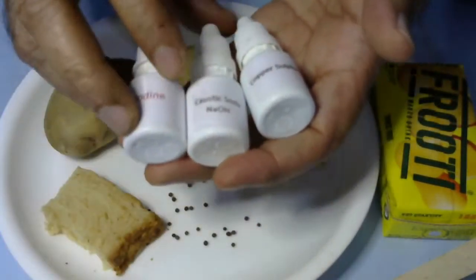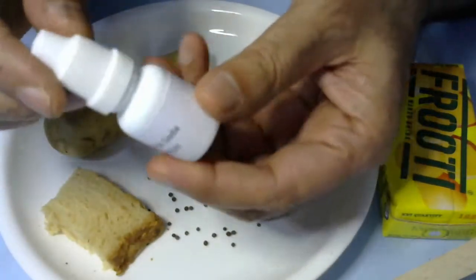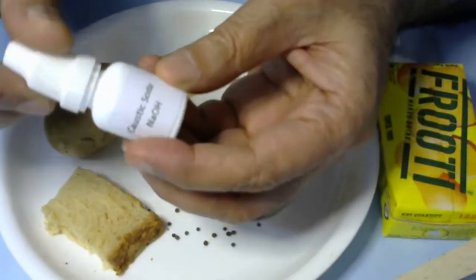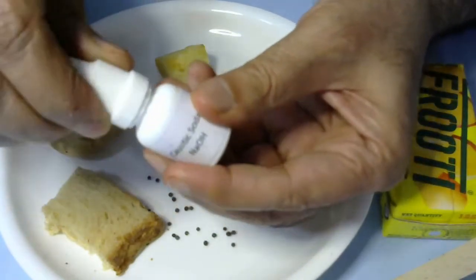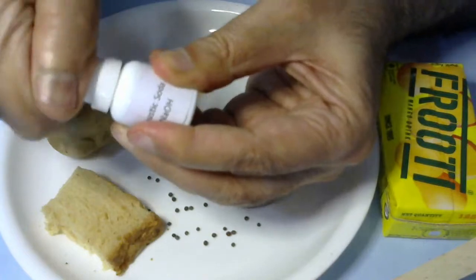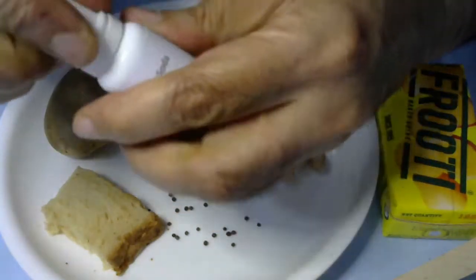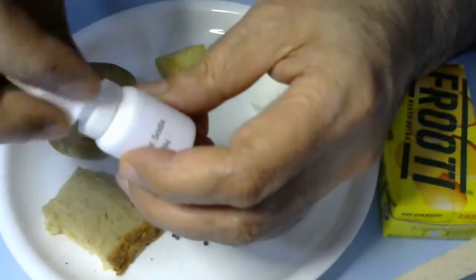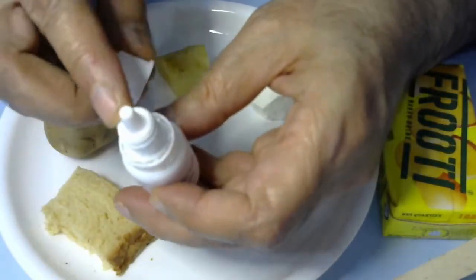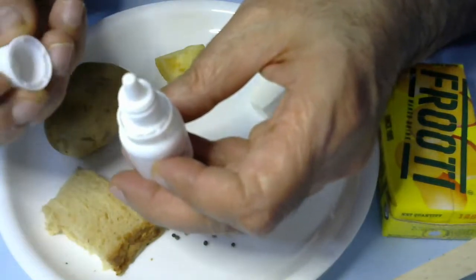All these bottles in your kit are sealed so they don't leak during transportation. Before you start using them, you have to tighten them completely. This will remove the seal when you open it, and the tightening process will make a hole in the nozzle so you can use these chemicals.